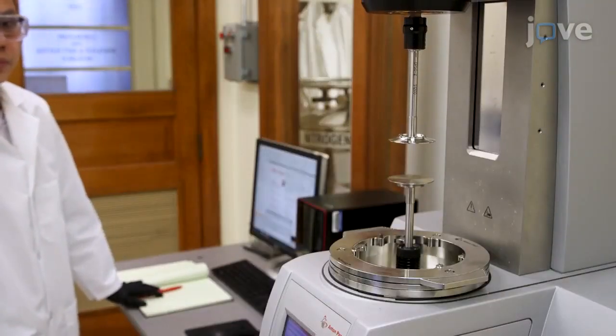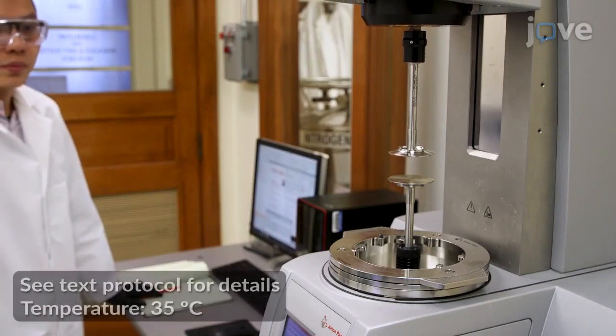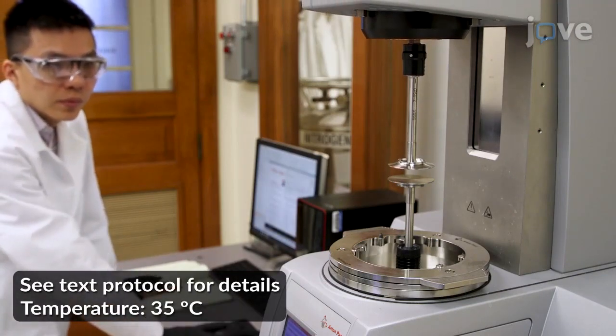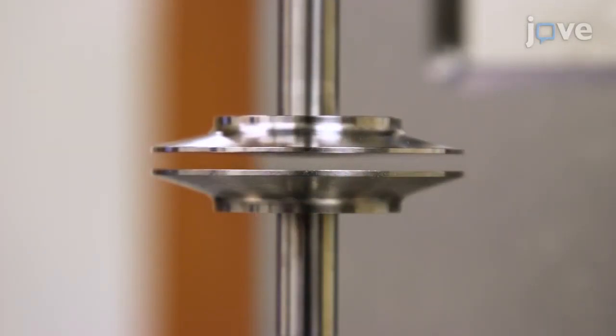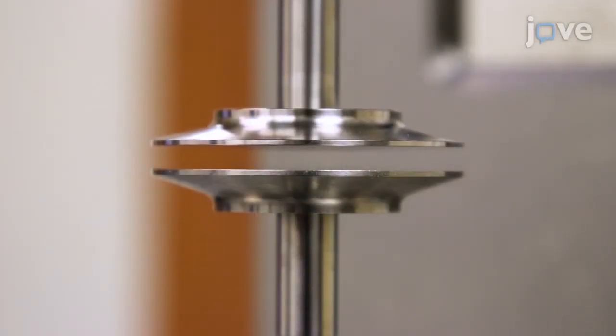Next, zero the gap, calibrate the measurements, and set the temperature. Once these steps are completed, open the gap in the geometries from zero to allow loading the material to be tested.